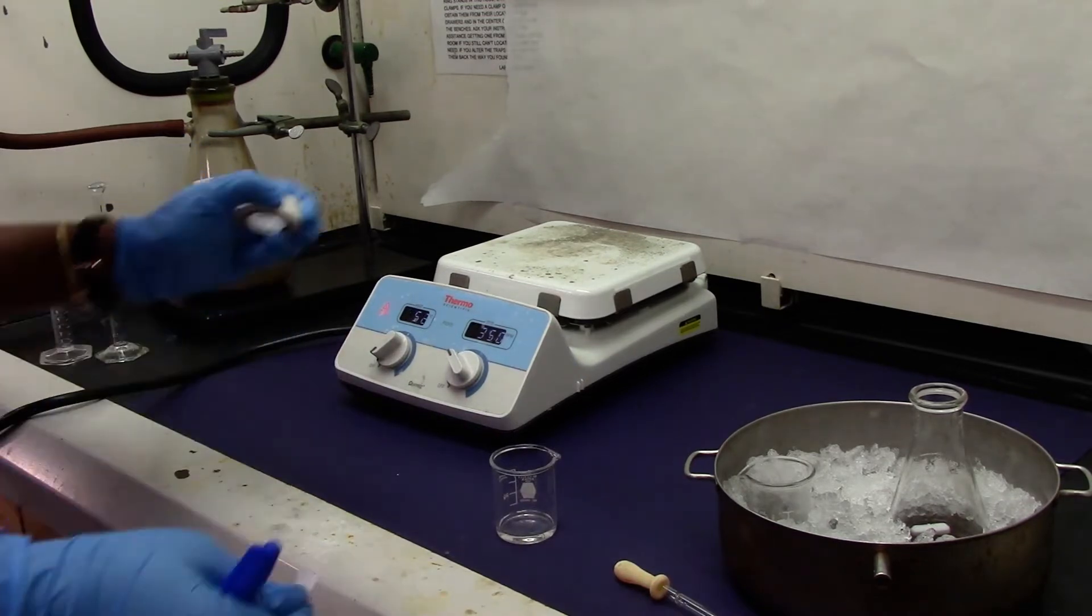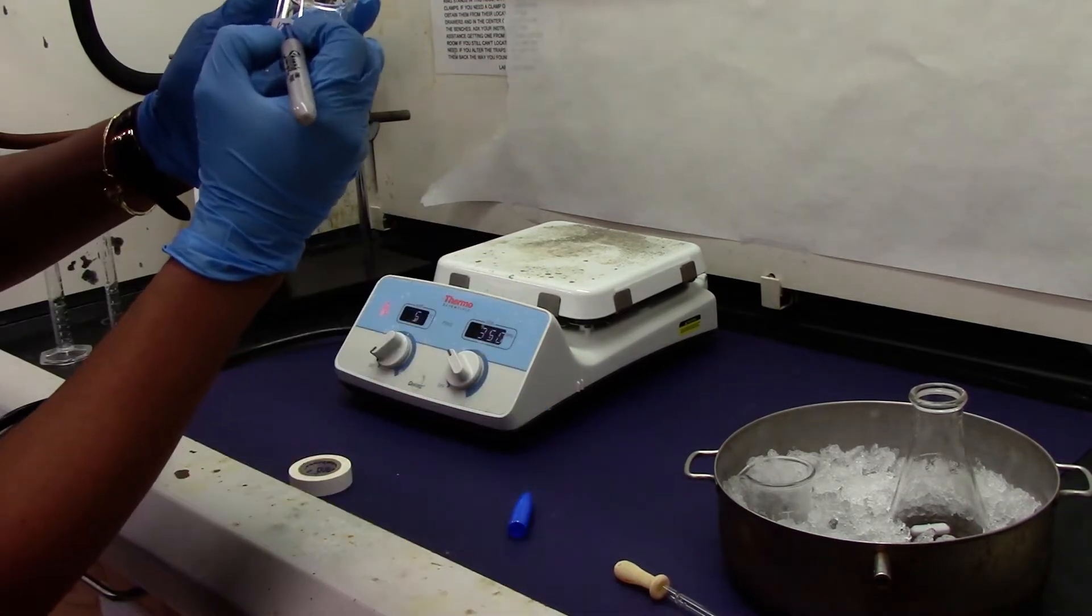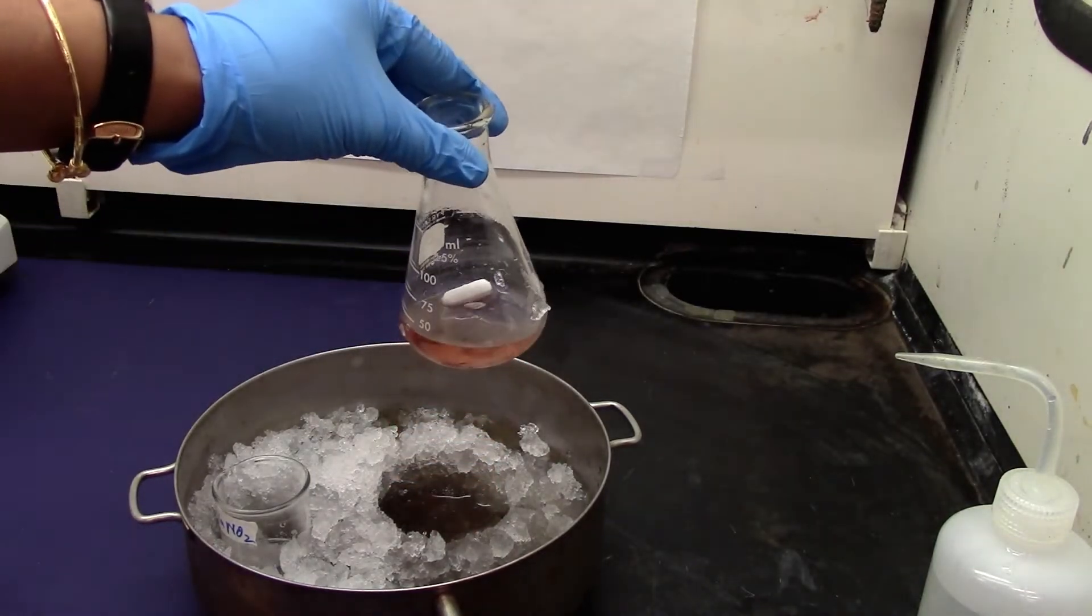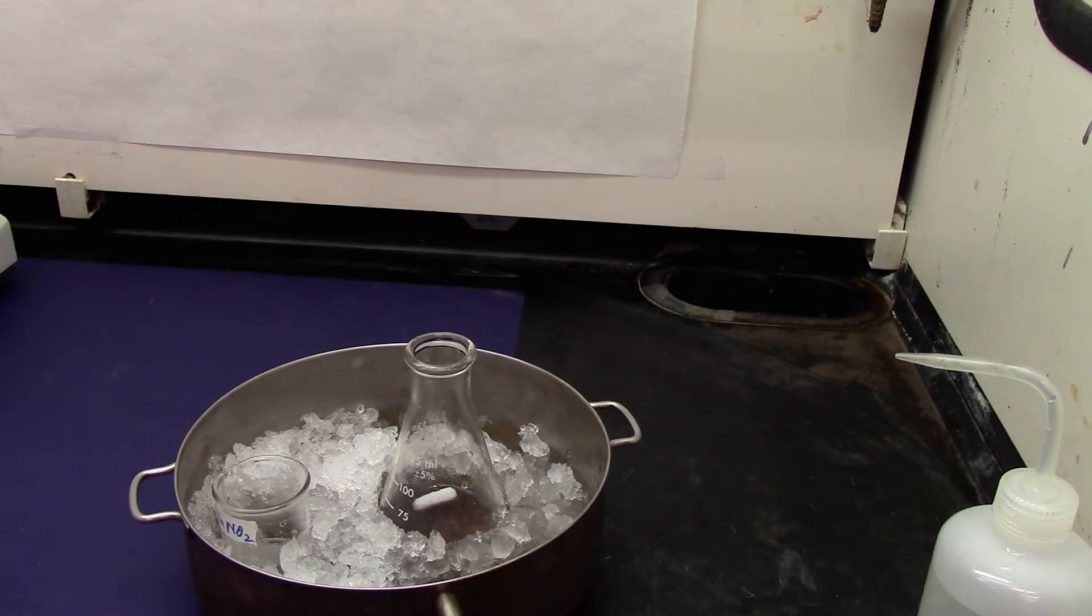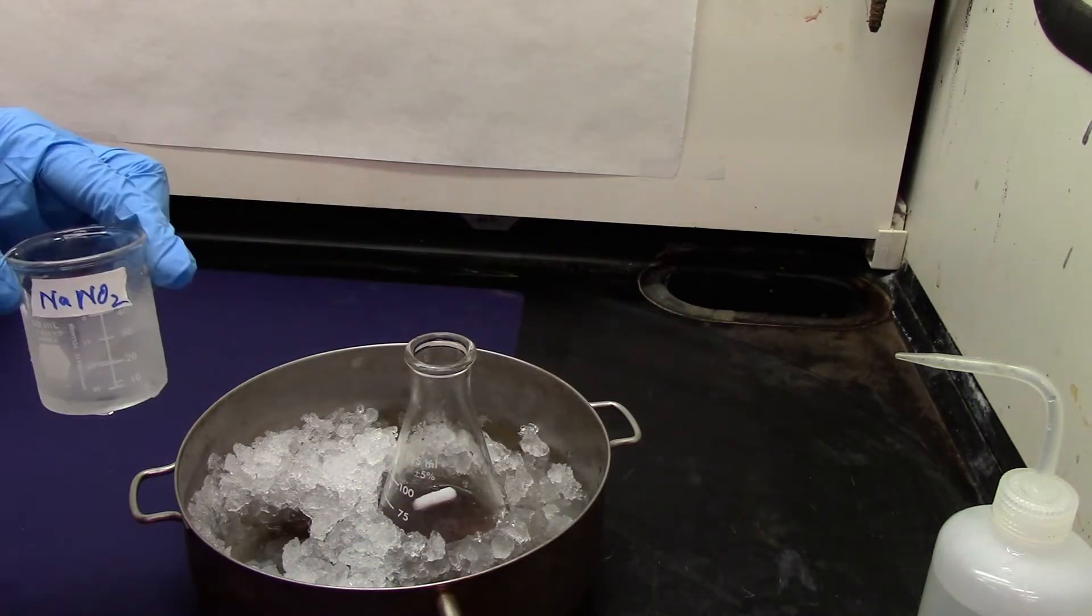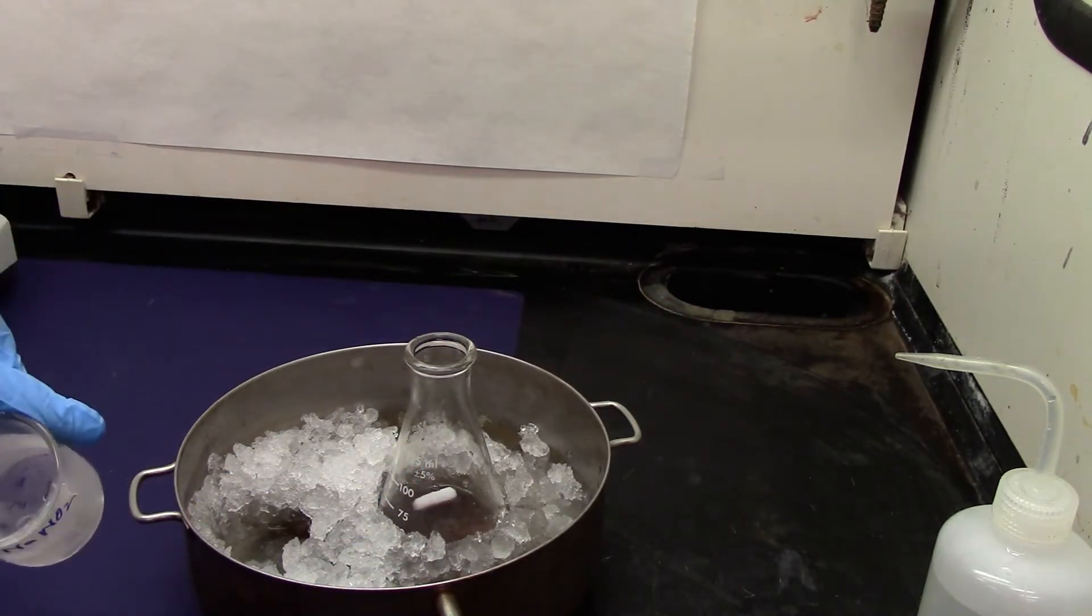I will label my solutions—that's potassium iodide. The solution has cooled down. I'm not checking with the thermometer but give it about 5 minutes to cool the solution. Using a glass pipette I will start adding cold sodium nitrite solution dropwise.